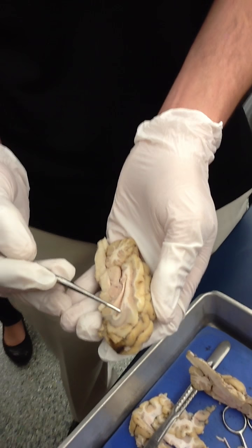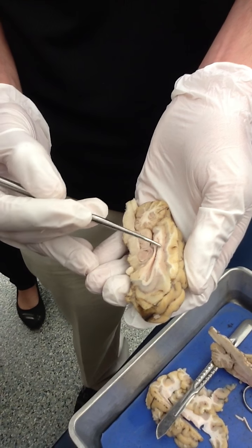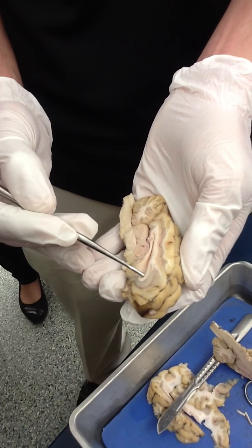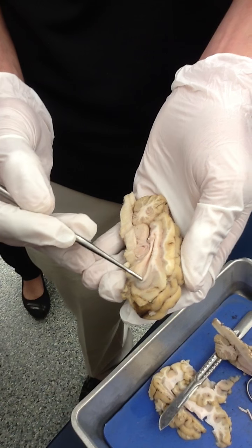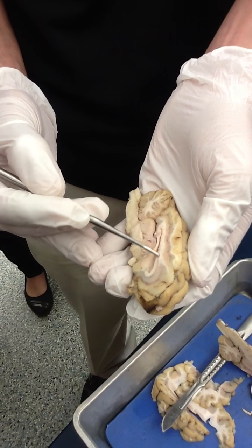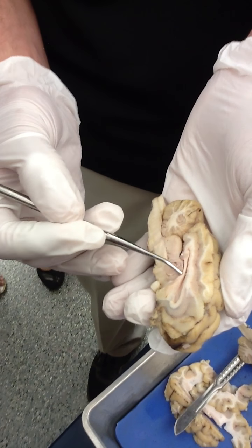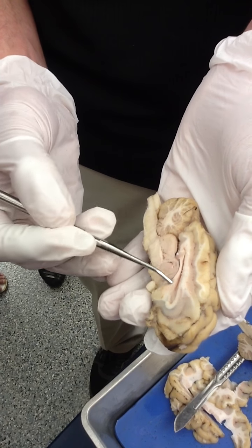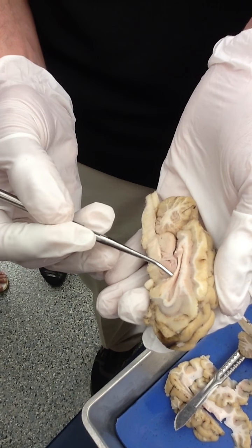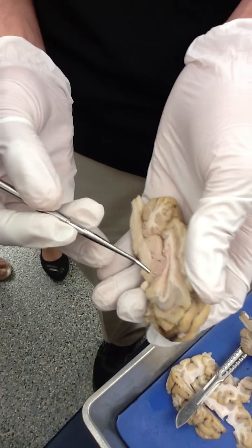This structure you see here — this band of white matter — is the corpus callosum, and that is the commissural tract that connects the right and left hemispheres of the brain. Then if we come down, we see this little band of white matter — that is the fornix. The corpus callosum and the fornix form the roof and the floor of the lateral ventricle.